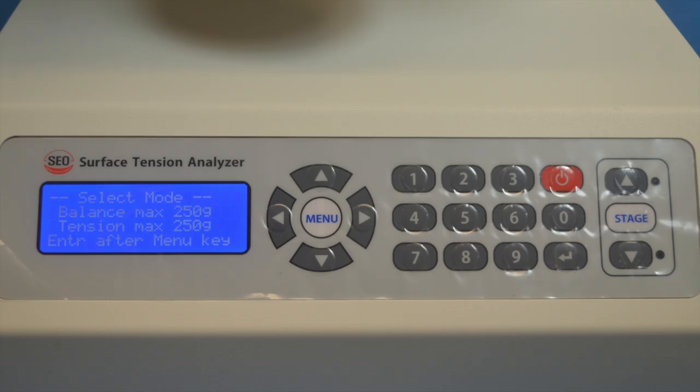At two times, you have to set the test parameters on the instrument: when you set up for new, or when you change the product, or you change a ring.